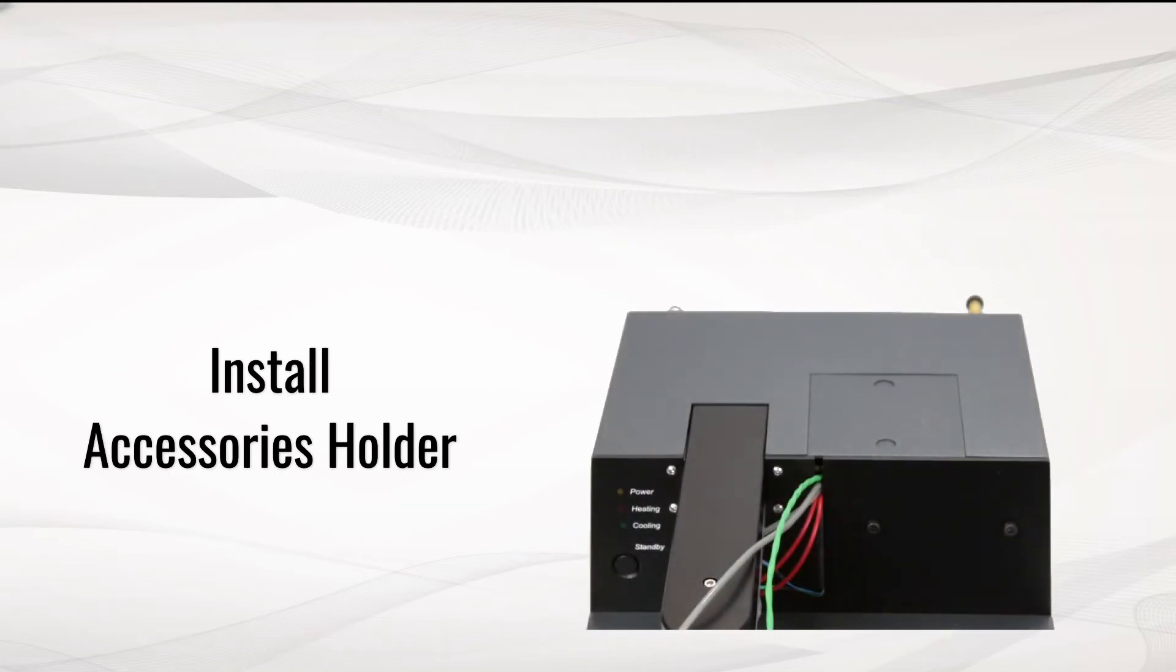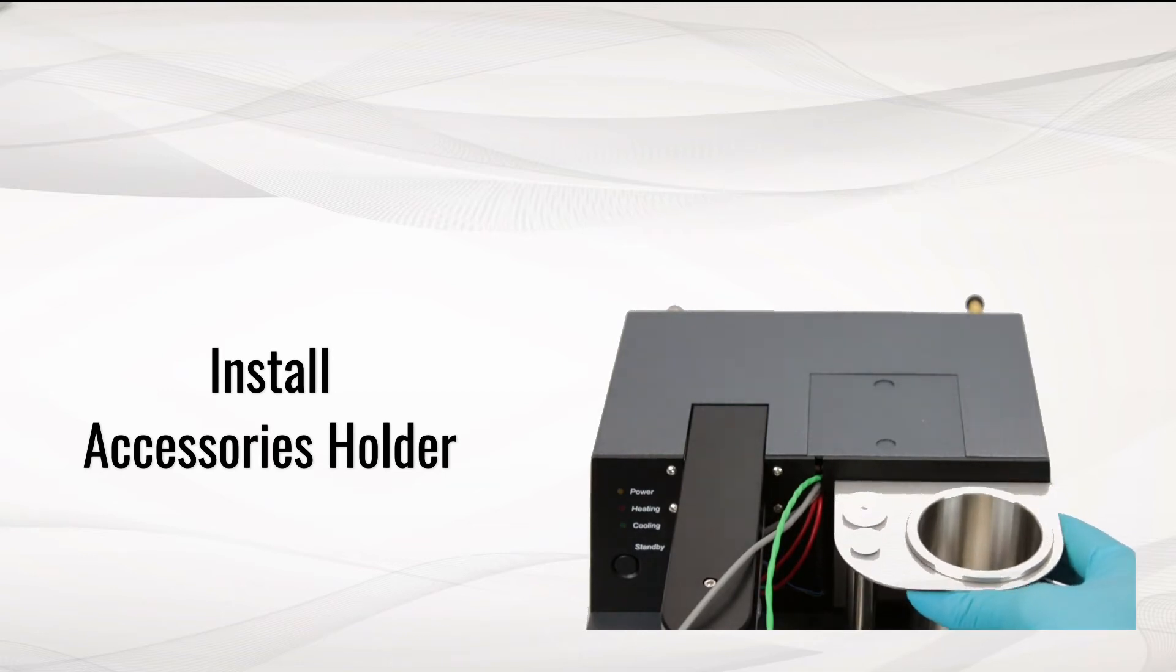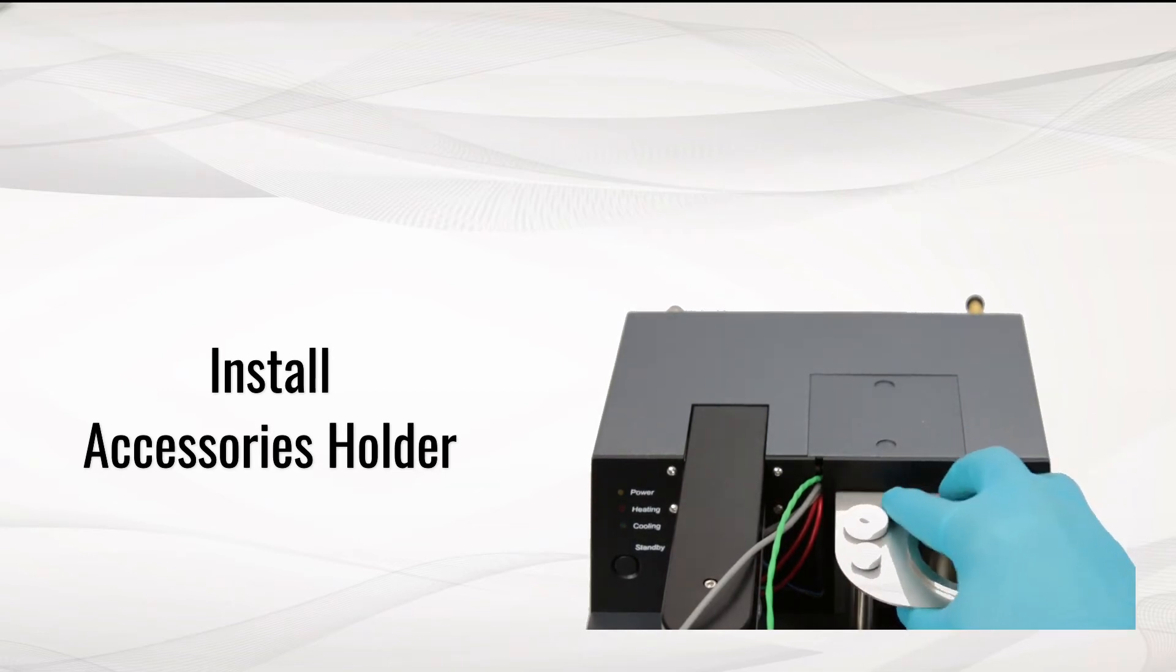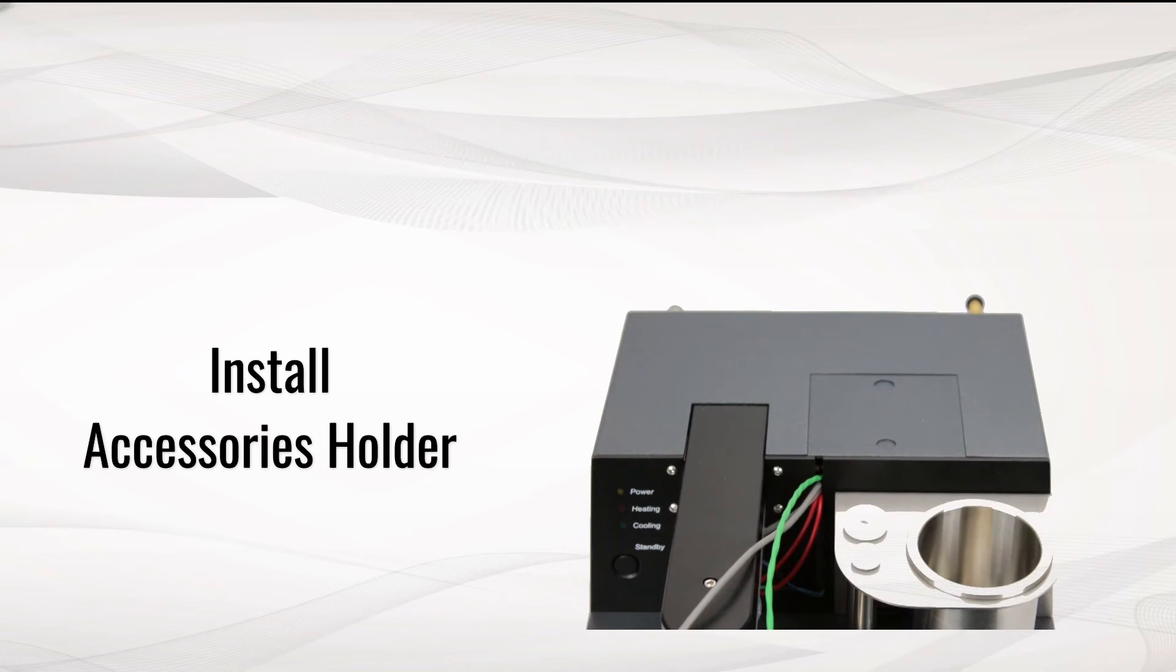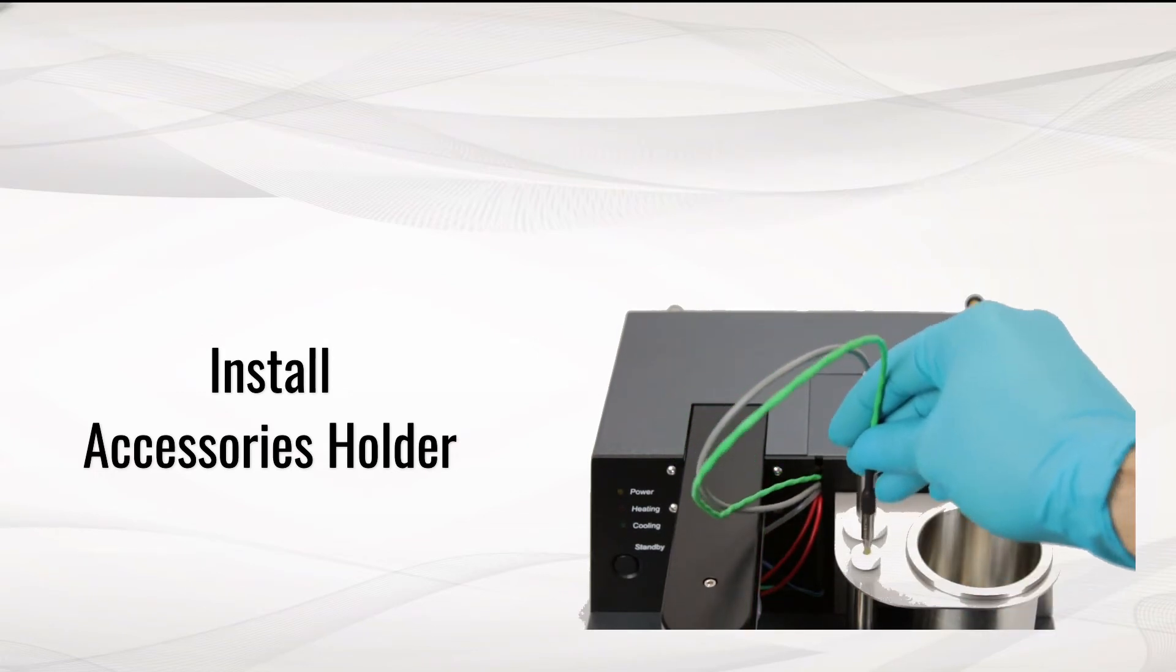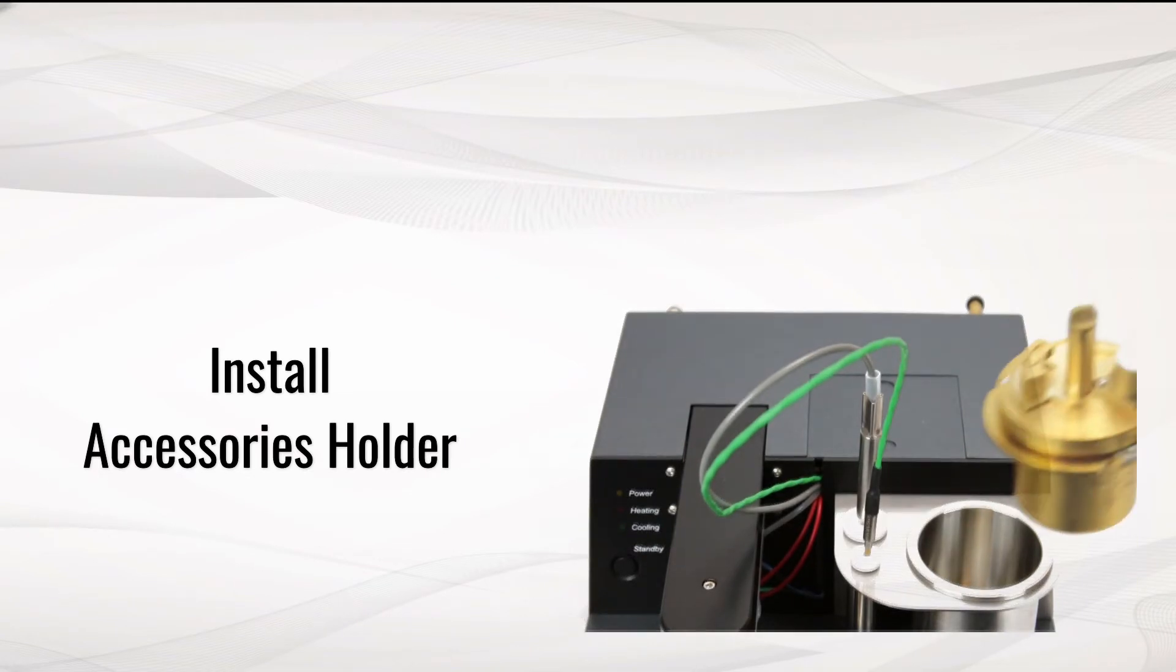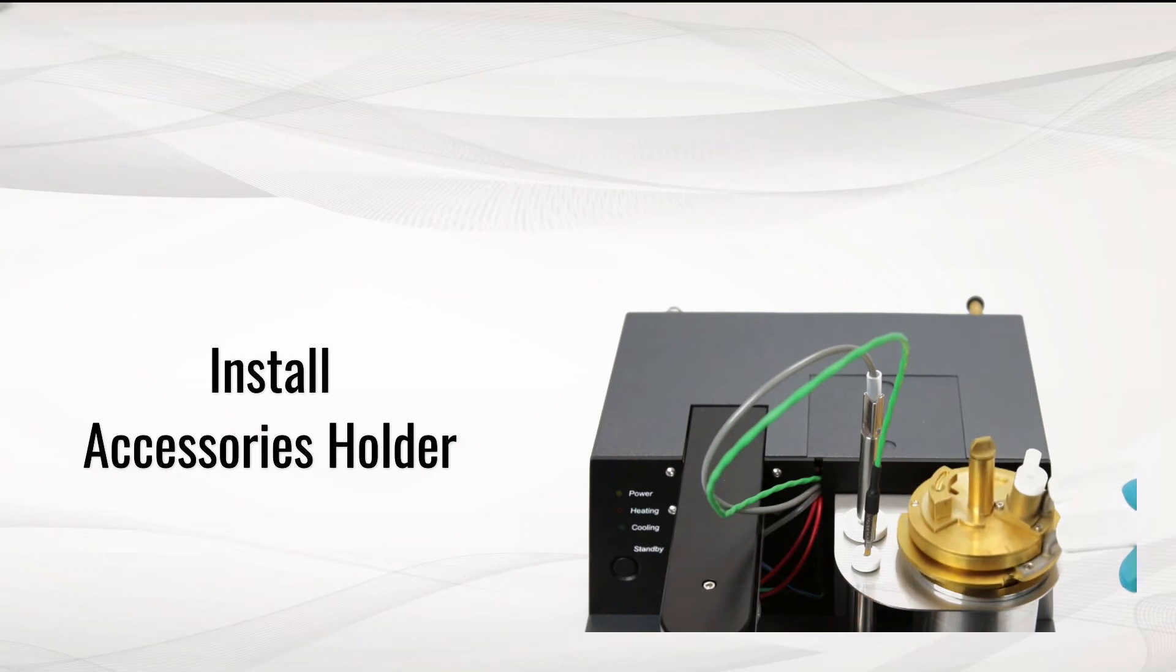Install accessories holder and put the sample probe and detection thermocouple in the holding place. Install cup and lid on the holder.